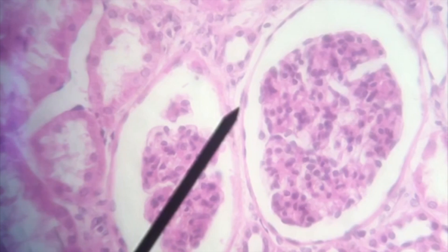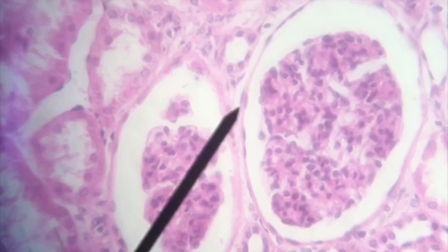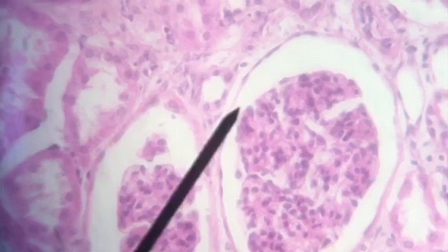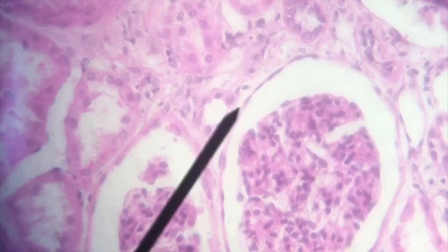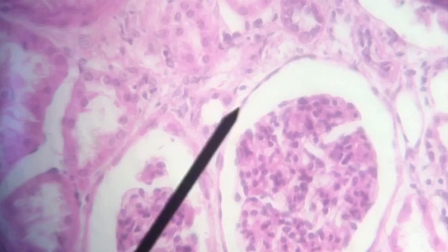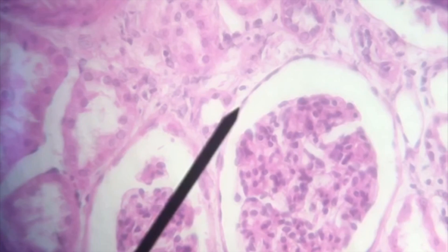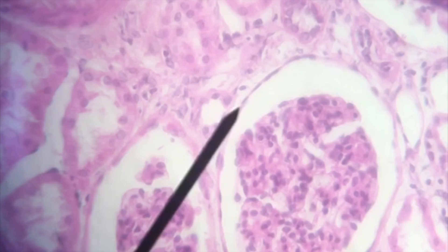The first slide we're going to examine is a cross-section of the kidney. Please note that we are looking at the parietal layer of Bowman's capsule. The arrow is now in the capsular space, and the ball that you see inside is the glomerulus. Notice that that parietal layer is a simple squamous layer of epithelium.